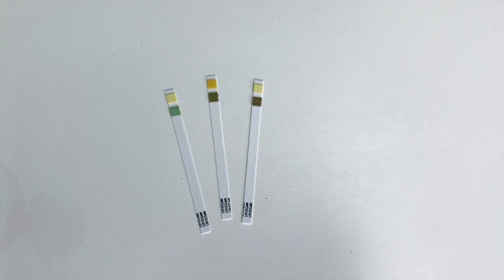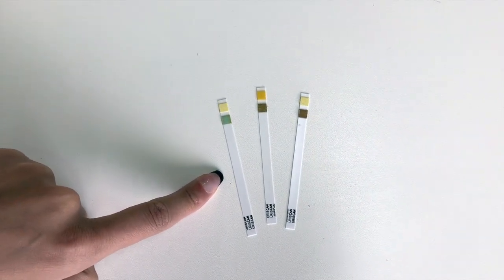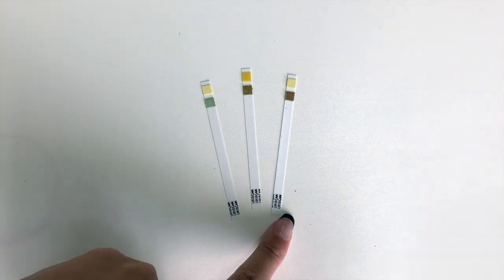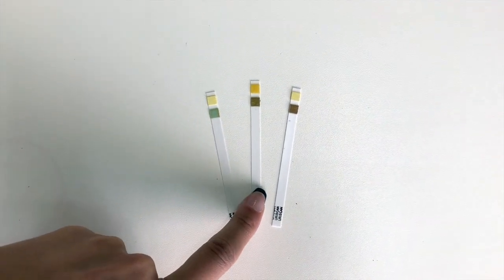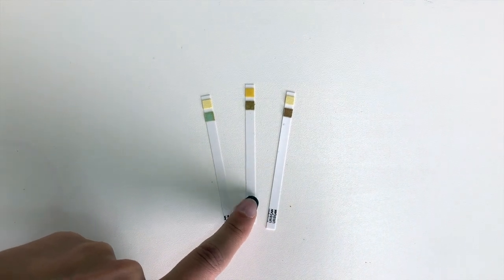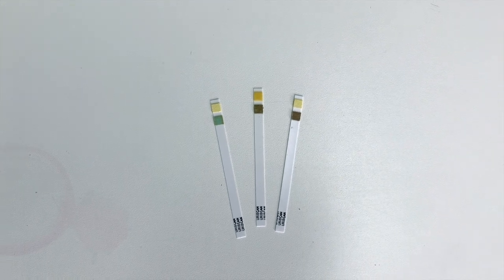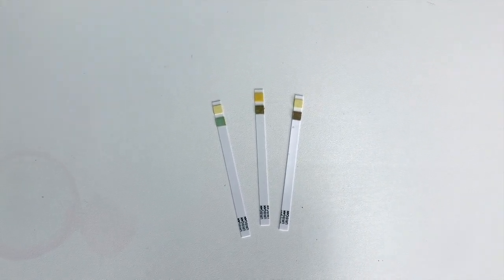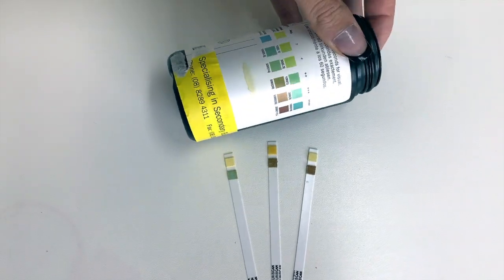We have our 3 glucose strips, our initial test of the outside of our beaker, which was just our iodine water solution. We have the inside of our dialysis tubing initially, and finally in the middle we have the iodine solution beaker after it's had a dialysis tubing of glucose and starch sitting in it for about 45 minutes. And we can compare those levels to our glucose chart.